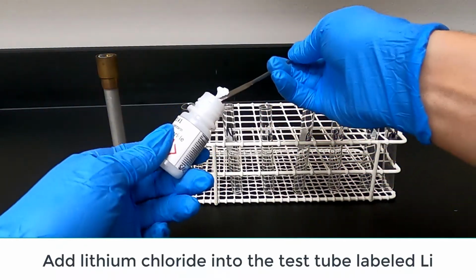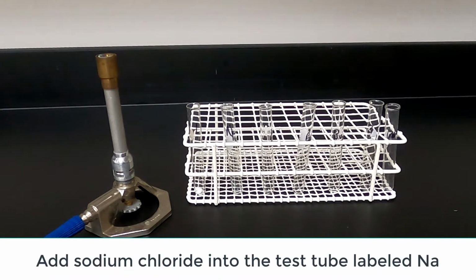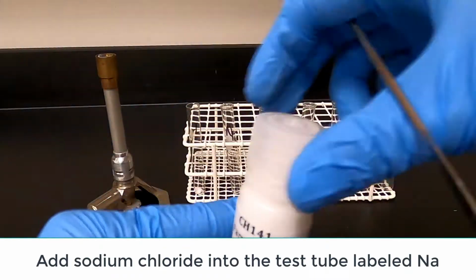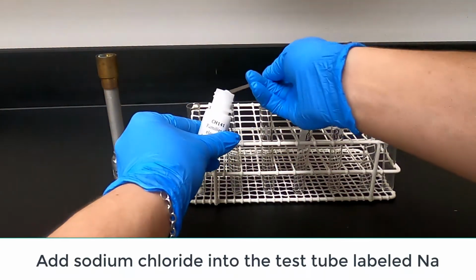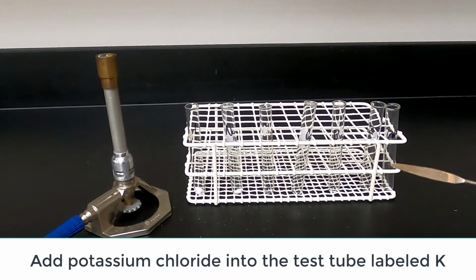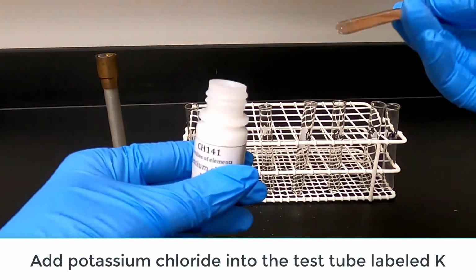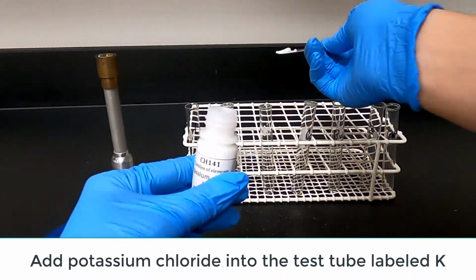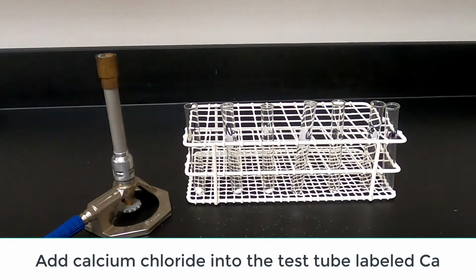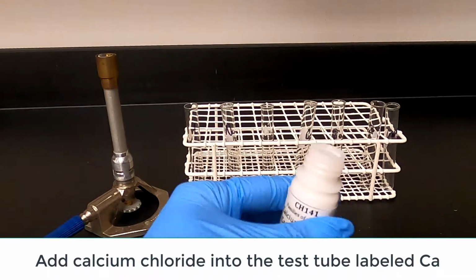Add lithium chloride to the test tube labeled lithium. Add sodium chloride to the test tube labeled sodium. Add potassium chloride to the test tube labeled potassium. Add calcium chloride to the test tube labeled calcium.